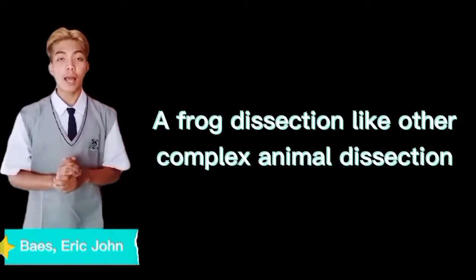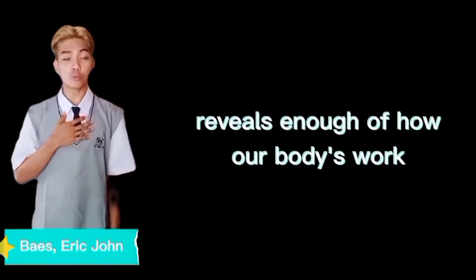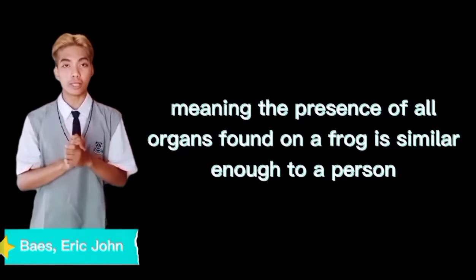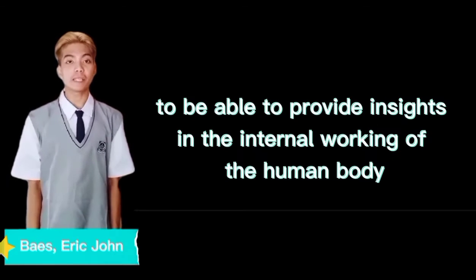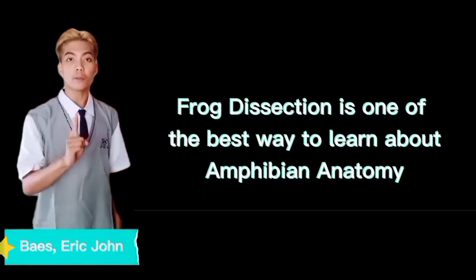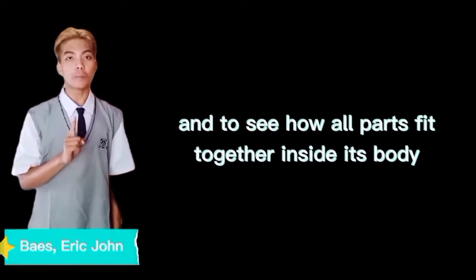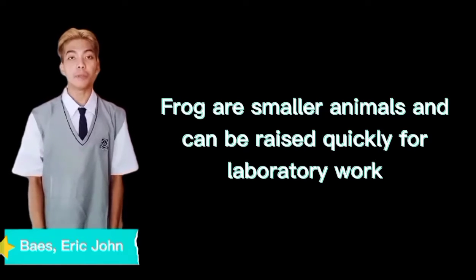Why do we dissect frogs? As it turns out, a frog dissection, like other complex animal dissections, reveals enough about how our bodies work to be valuable. Meaning to say, the presence and positions of all organs found in a frog is similar enough to a person to be able to provide insights into the internal working of the human body. Also, frog dissection is one of the best ways to learn about amphibian anatomy and to see how all parts fit together inside its body. Frogs are smaller animals and can be raised quickly for laboratory work.